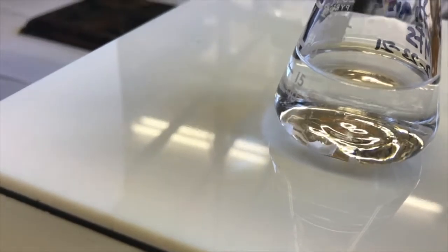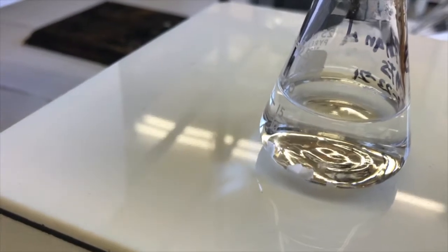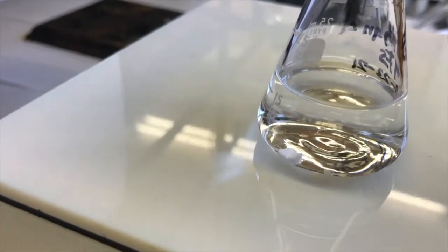See the little tiny bubbles. They'll help ease the boiling so I won't have it bump out of the flask and all over the place. We don't want that. Okay, we're getting there. It's got a nice bubble to it. If it gets a little too bubbly, I'm going to turn down the temp, which I'm actually going to do now. Turn it back to 100. I think this looks pretty good.